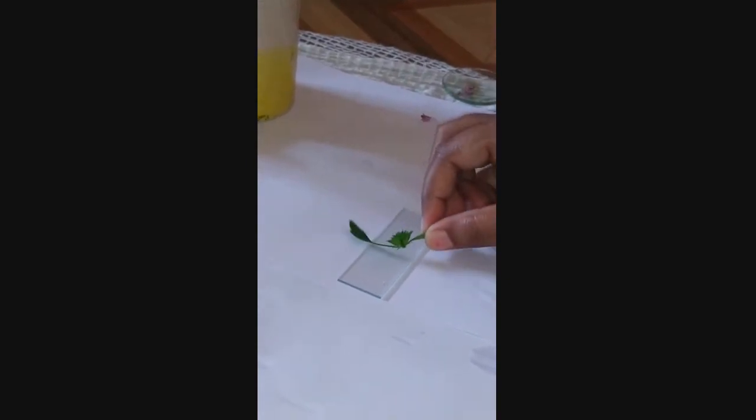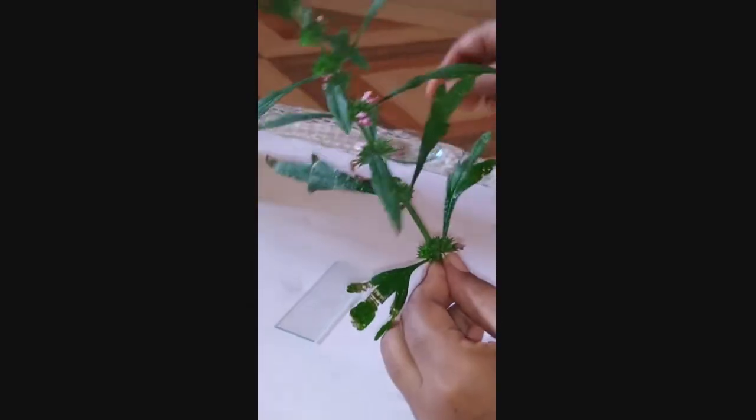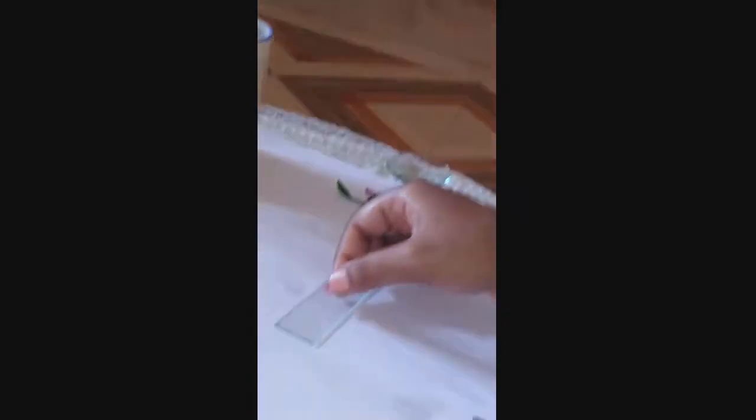Next we come to the flower. If we come to a single flower — we have isolated a single flower from the inflorescence. That is the single flower of Leonurus Sibiricus. The flower is approximately 2 cm to 2.5 cm.